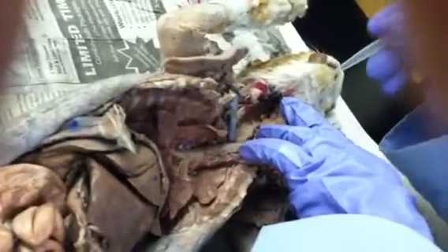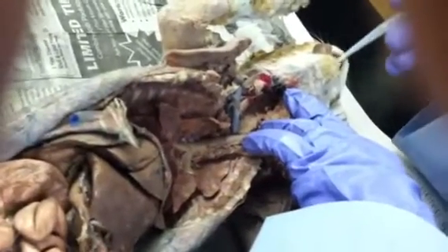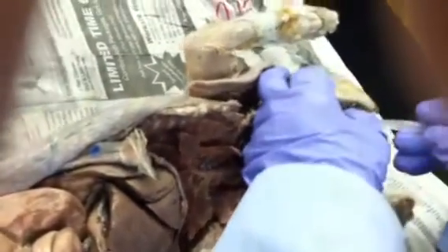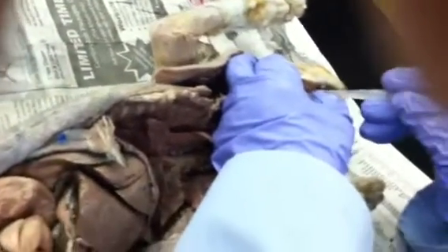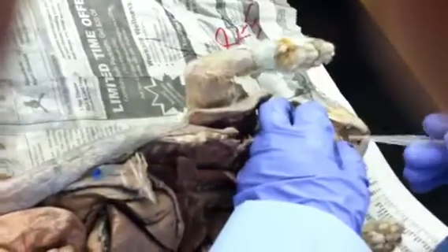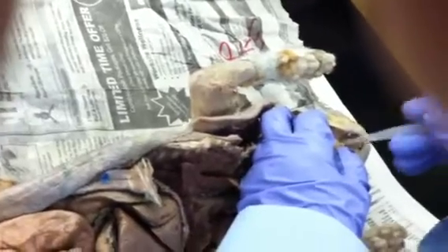Then the oral cavity: you have the rugae, which are the ridges, and the teeth, with the incisors and canines being the main teeth. You have the tongue with the papillae, and the papillae have taste buds, but in the cat, they also clean their fur with them. So your tongue is used for chewing, for moving the food around, and for tasting the food, but in the cat it's also used for cleansing.